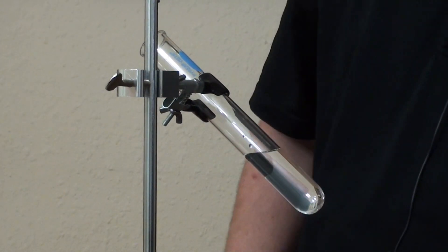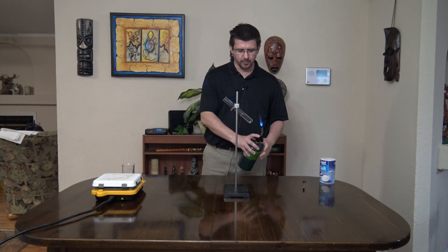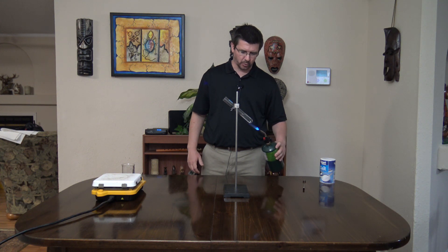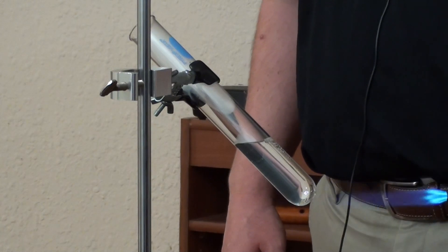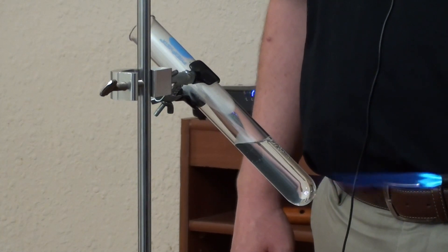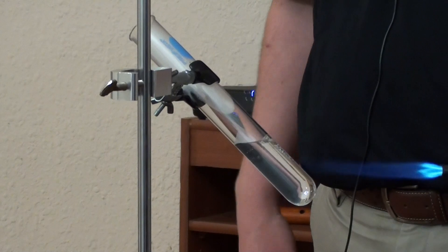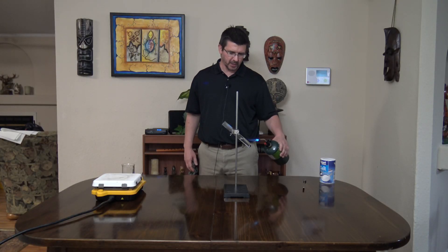We have our test tube here in a clamp. All I'm going to do is use my torch to heat the bottom of this and boil the water. You'll see, because it's a small amount of water, it's going to start boiling fairly quickly. But we should be able to get our salt out of here. You can already see bubbles starting to form in the water, and that's because the water is getting warm enough — it's getting above 100 degrees Celsius, which is causing the water to boil off.